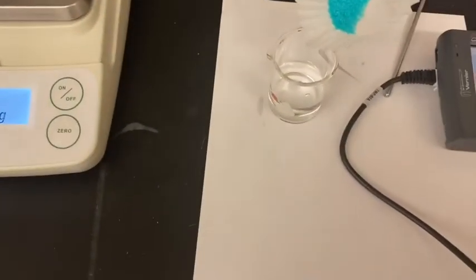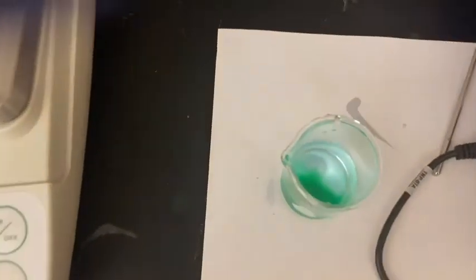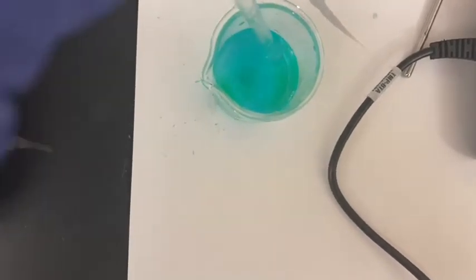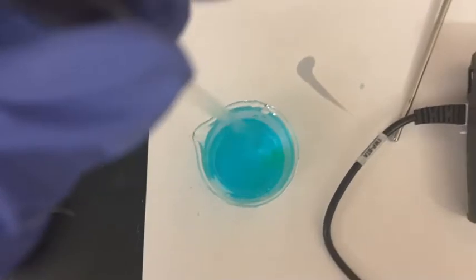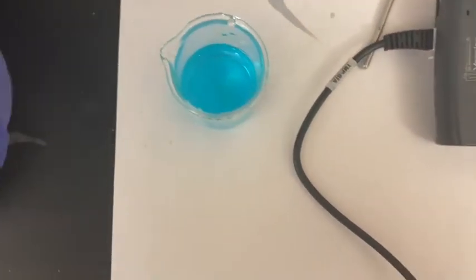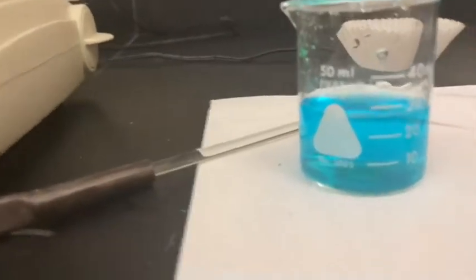Adding my copper chloride crystals to the beaker. I put it on paper just so you can see the color a little better. Give it a little stir. You can see that it is turning a nice bluish, aqua color — however you want to describe it. But even though it is colored, it is still clear or transparent.